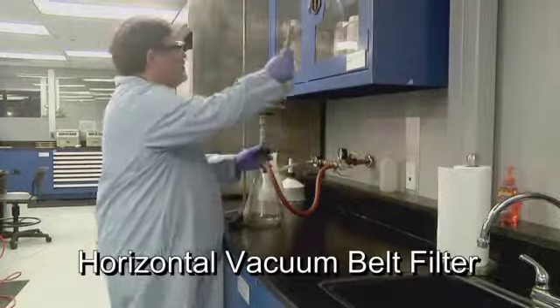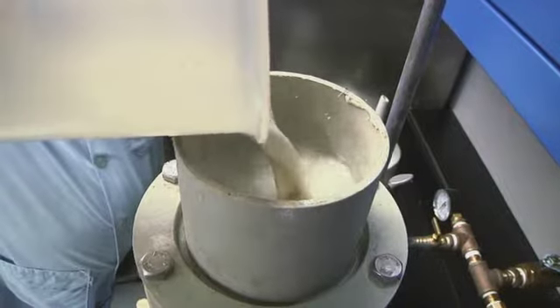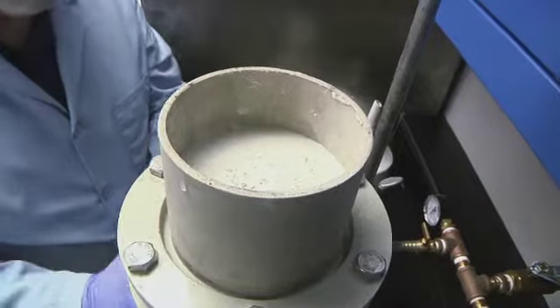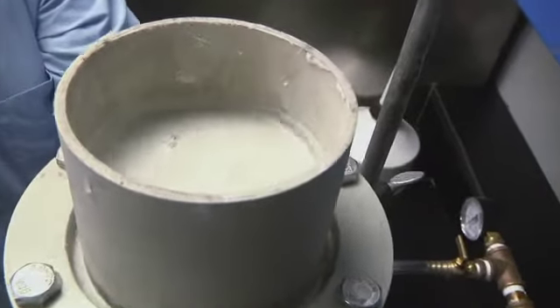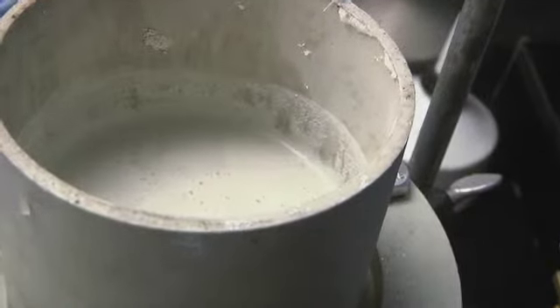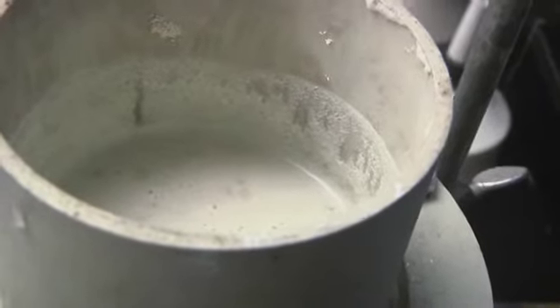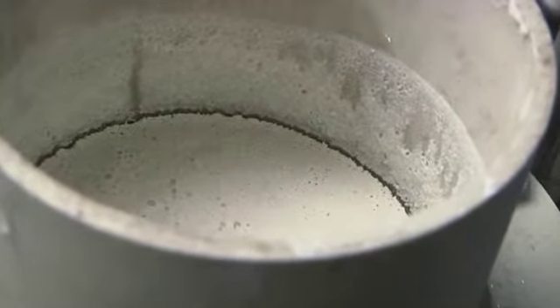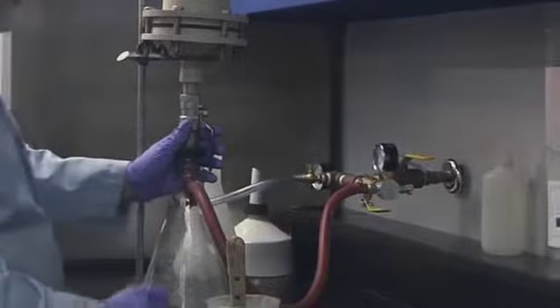Horizontal vacuum belt filter is tested with a modified Buchner funnel to allow a filter fabric to be used. A sample is poured into the Buchner funnel and vacuum applied. Time is recorded when the vacuum is turned off to the Buchner funnel. The time from the cake formation time to this point is the cake dry time.